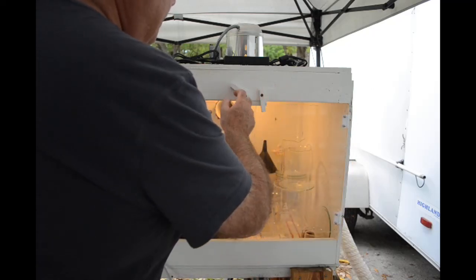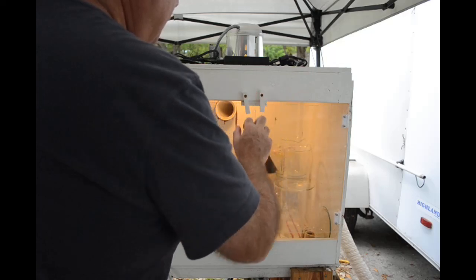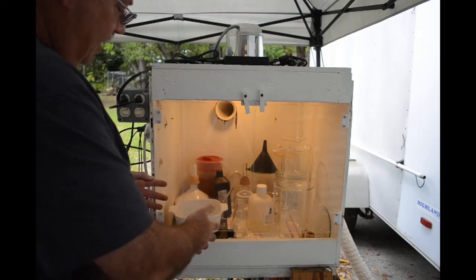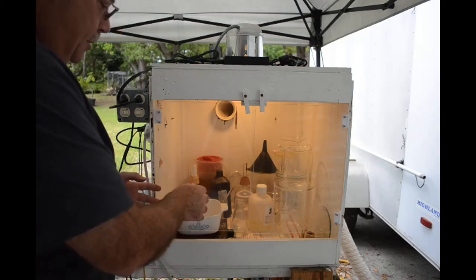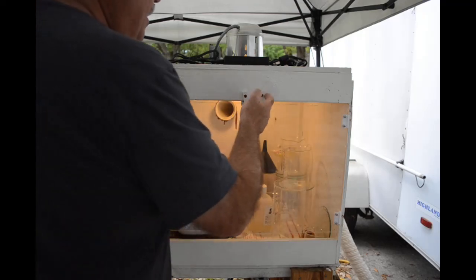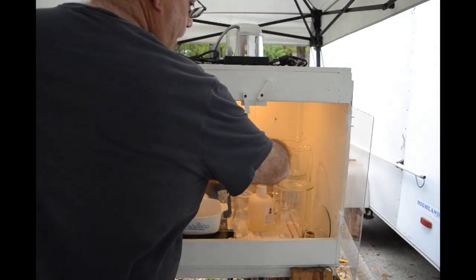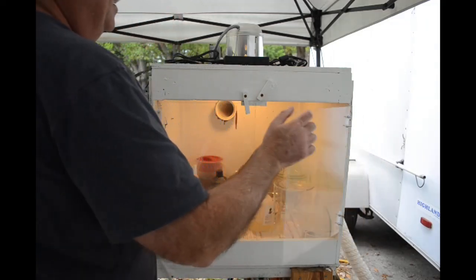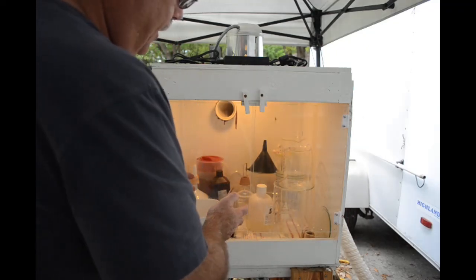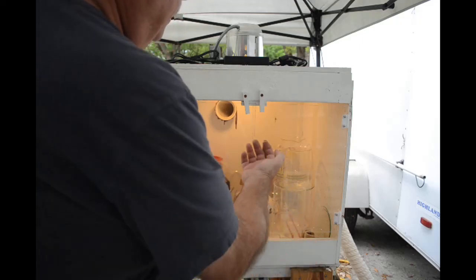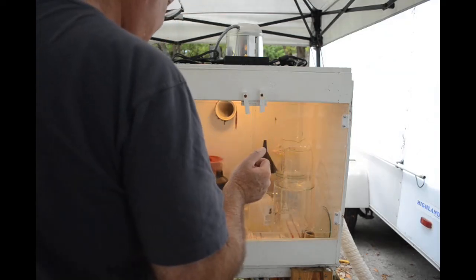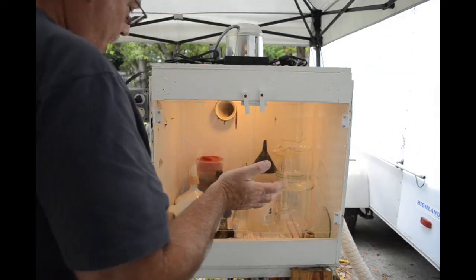I did that on purpose because if I'm working on some sort of project right here on the hot plate and I'm worried about a furious boil over, I can sort of reach around and use this as a shield. With the doors overlapping, if there is some sort of violent boil over nothing can come straight out. There's not a gap there anymore so that's good.